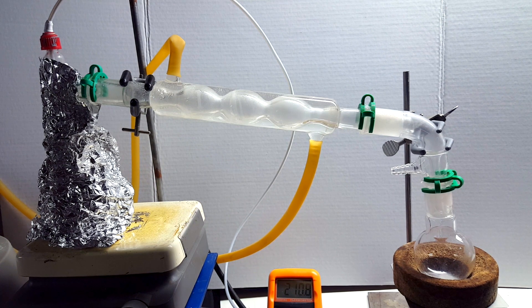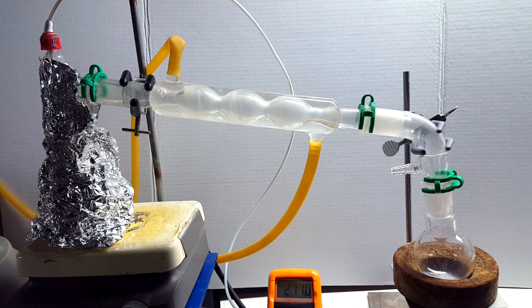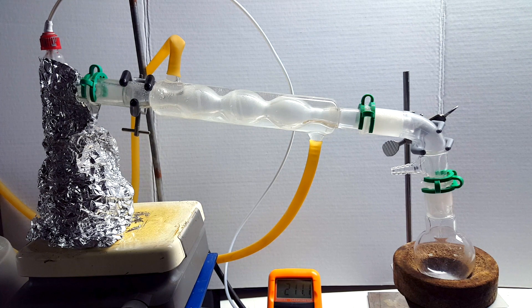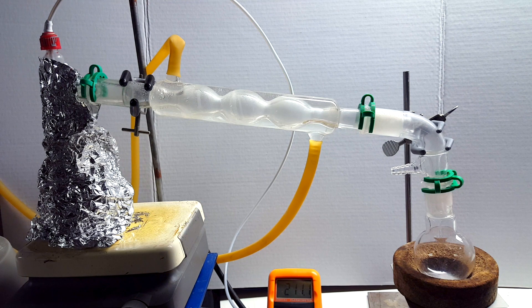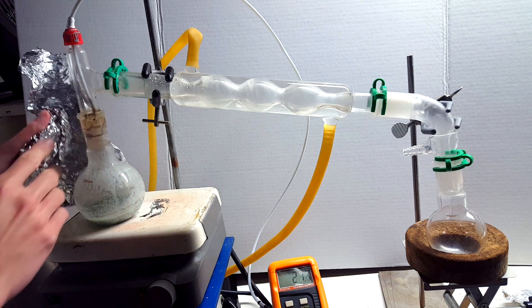At that point, I realized, like I said before, distillation of phosphoric acid is incredibly difficult, if not nearly impossible. This is why, of course, chemists set out to find the resins, chelating agents, etc., to separate metal ions from the acid. So I turned off the heating and let everything cool.